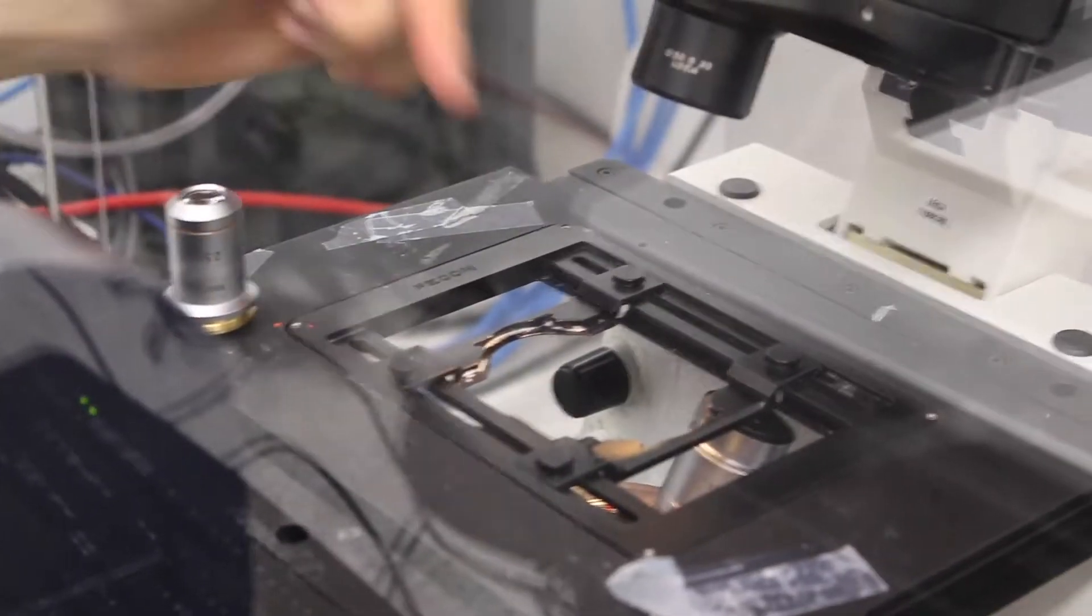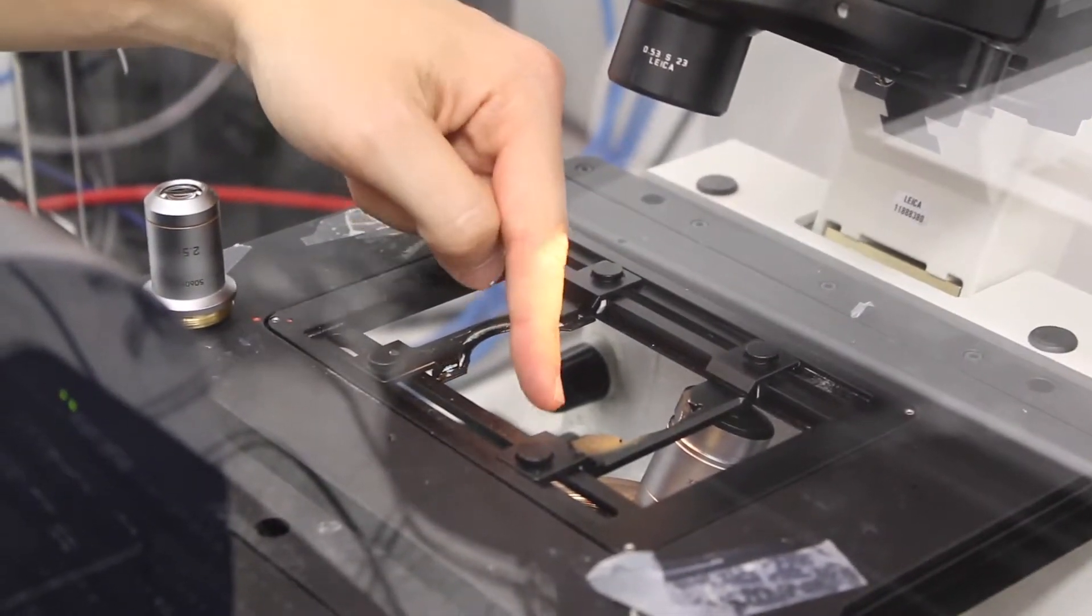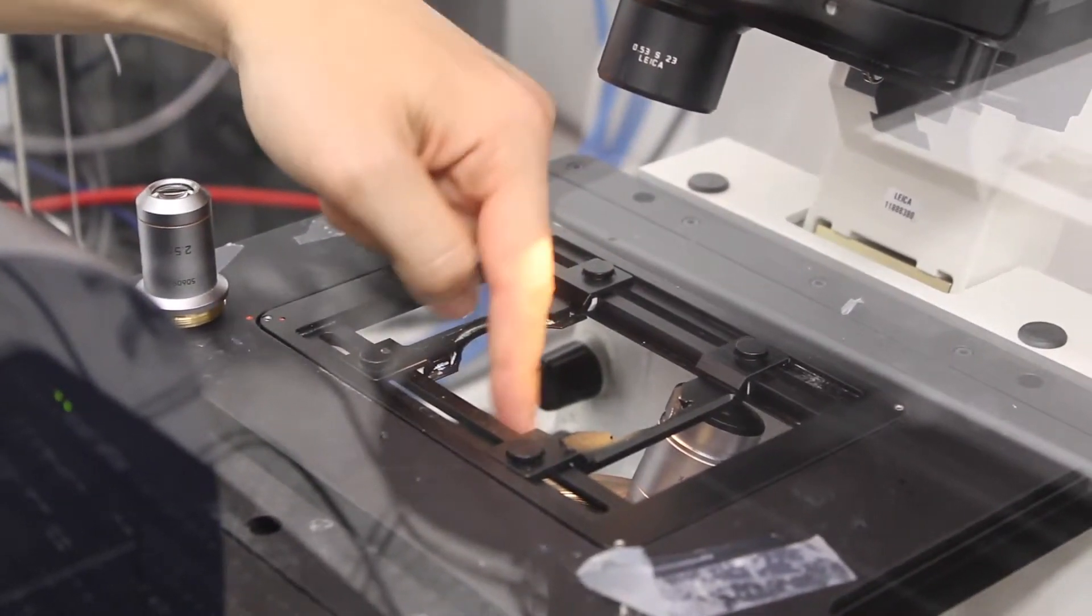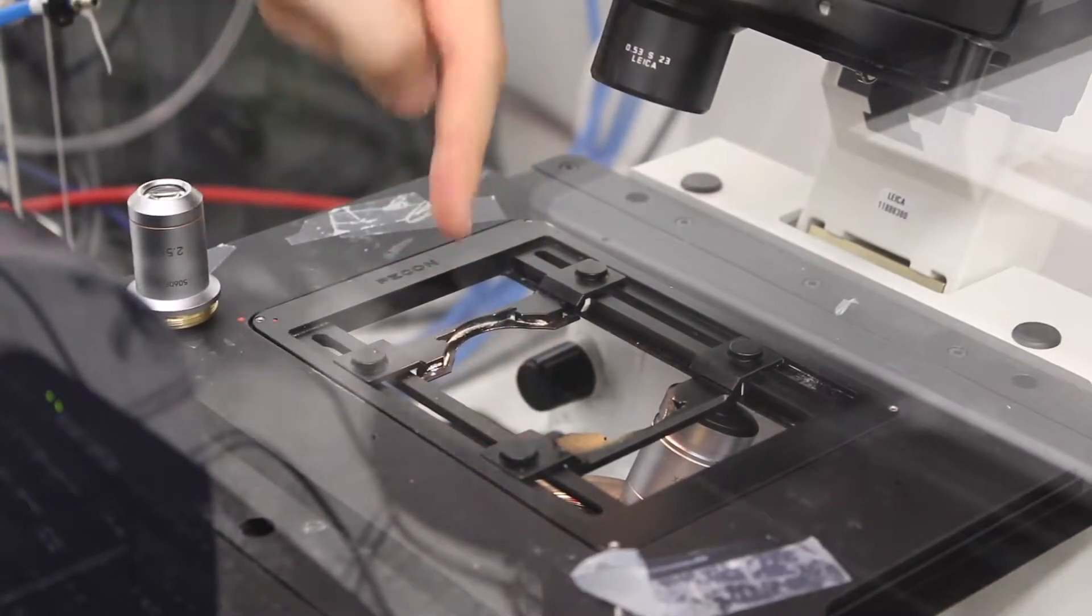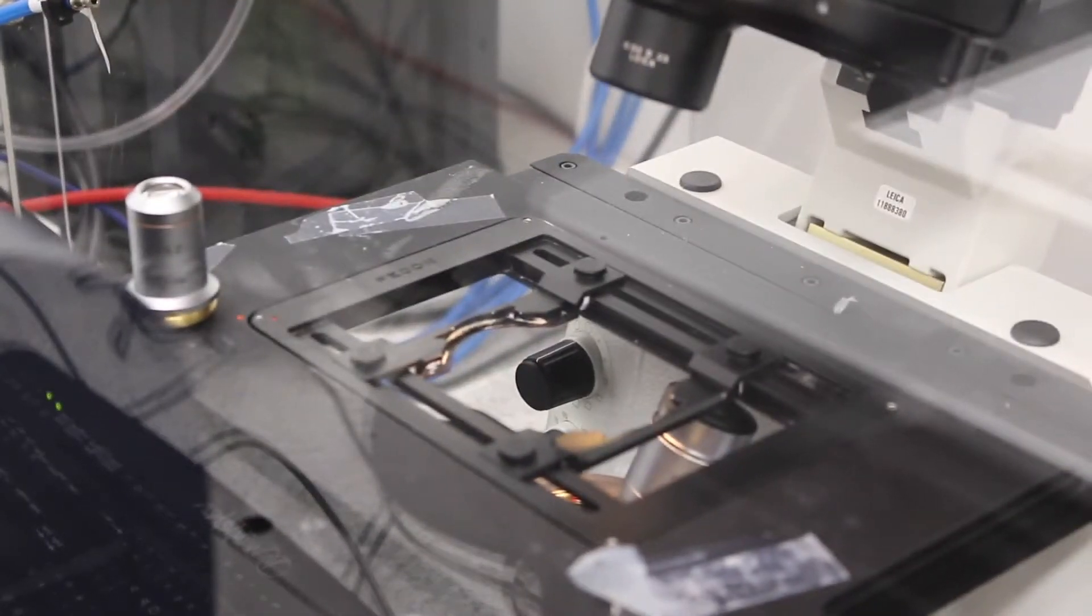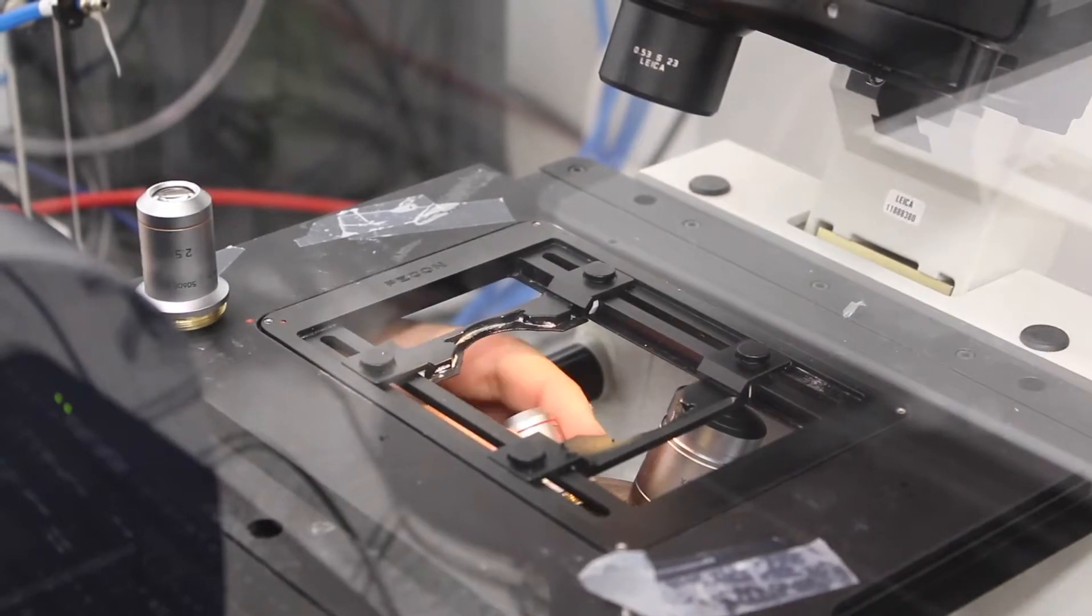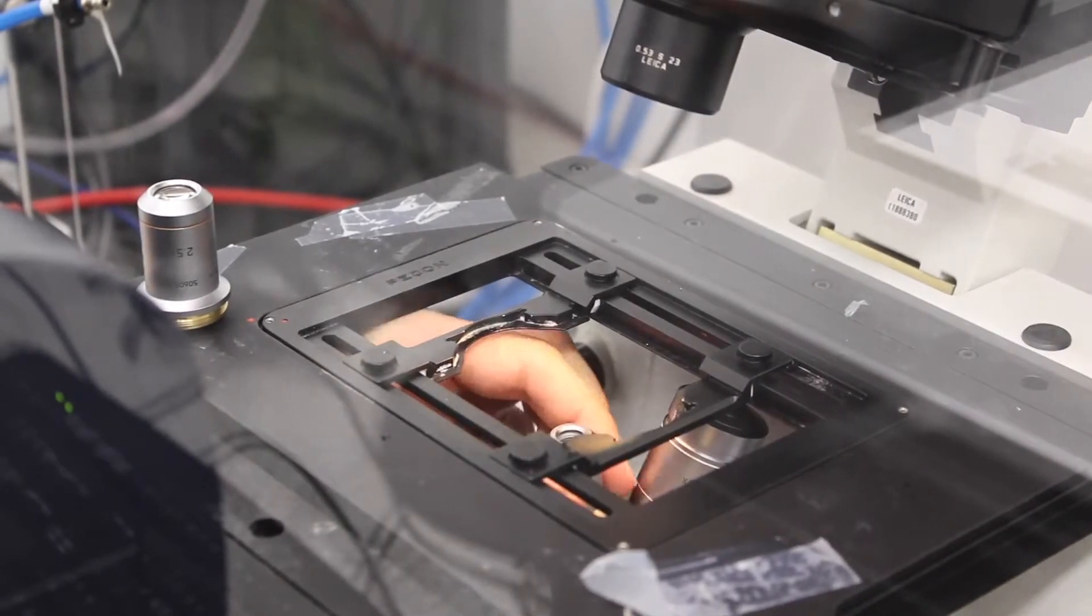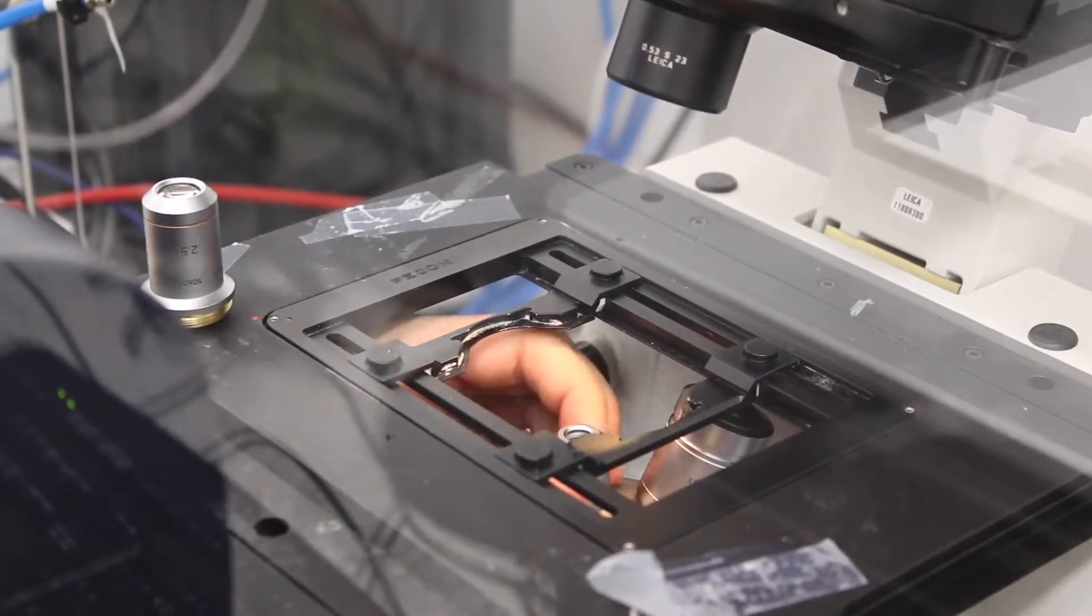Then, of course, you shouldn't leave the hole here, the objective empty, because dust will go inside the objective wheel, so you need to put the other one and screw it.